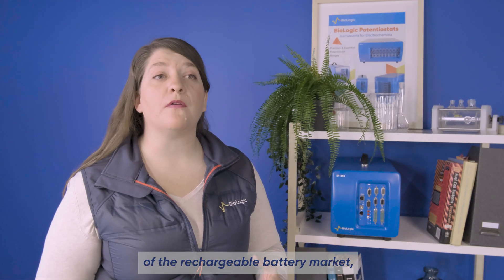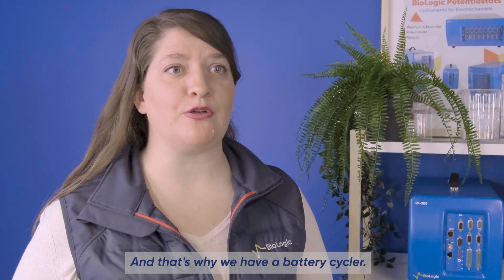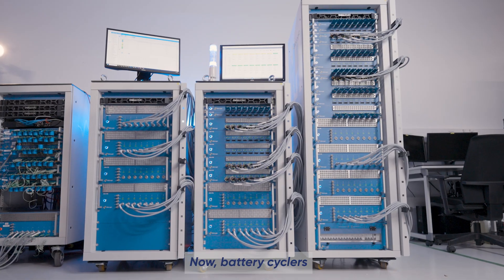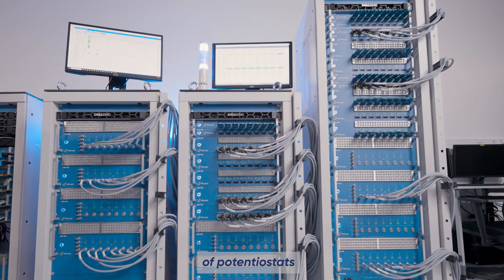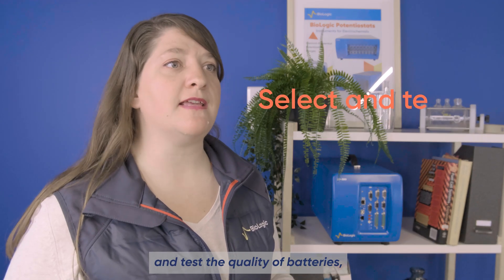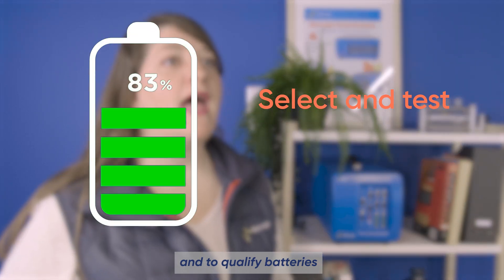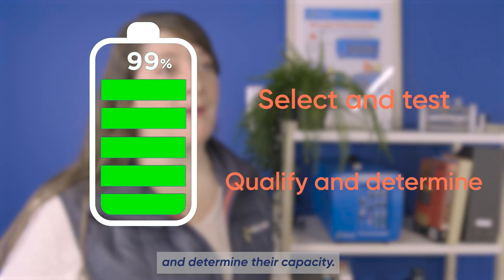With the growth of the rechargeable battery market, there's a need for a product that addresses the specific challenges in this field, and that's why we have a battery cycler. Battery cyclers share many of the characteristics of potentiostats but are used to answer two primary needs: to select and test the quality of batteries, and to qualify batteries and determine their capacity.